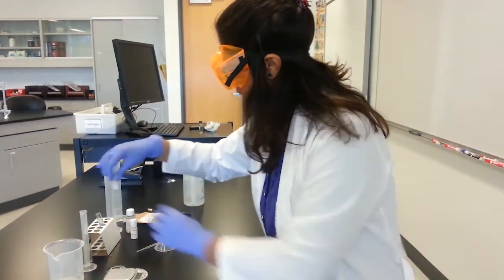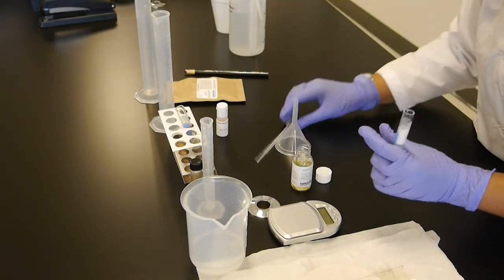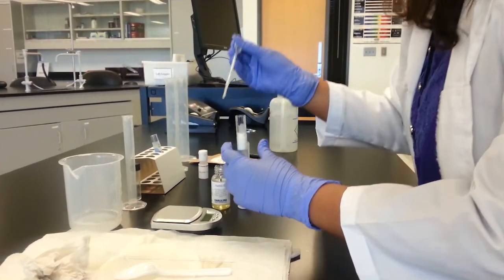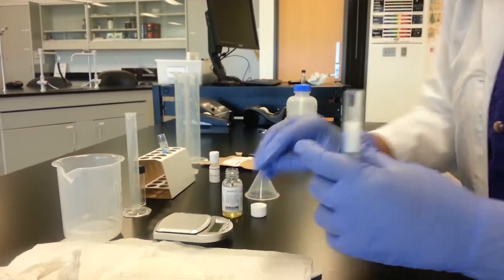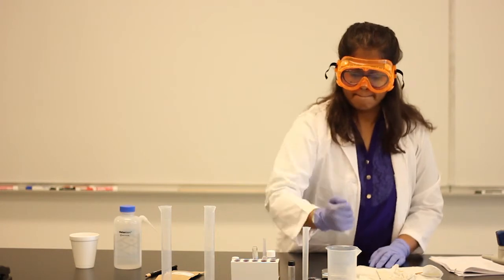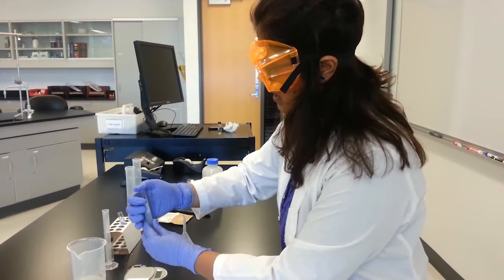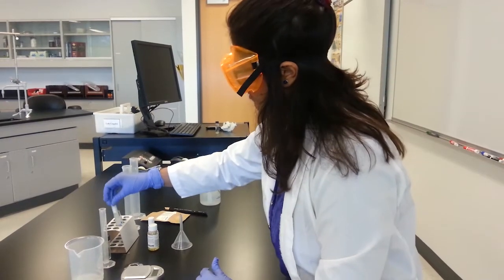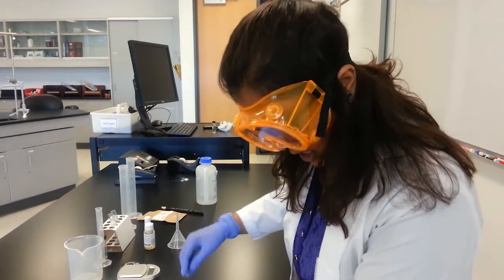Okay. Let's add about 2 drops of vegetable oil. This. Shake it again. And see what you got. All right. Make sure to take a photo of this. It'll be different for each person.